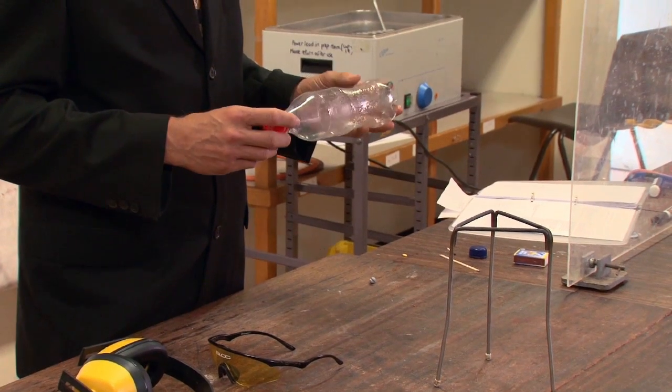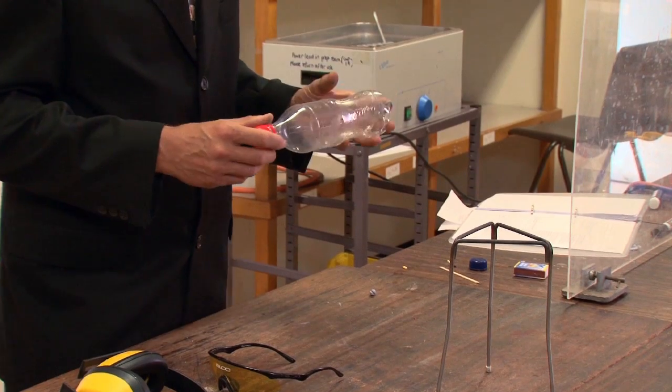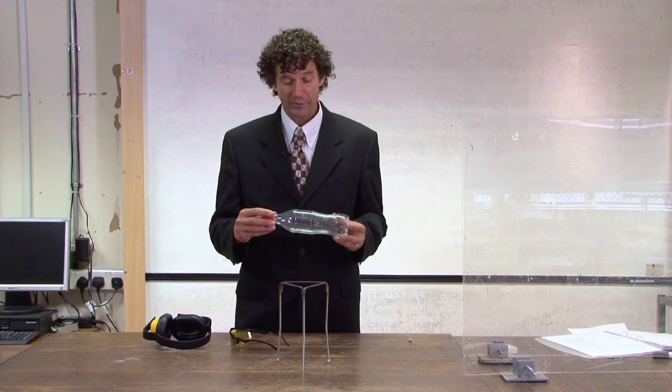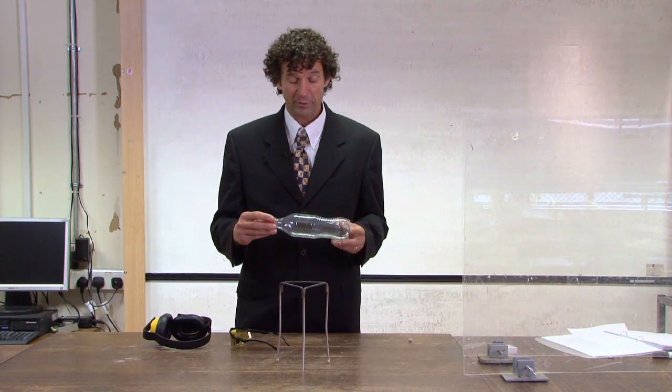This experiment fits into the curriculum quite nicely when you're doing energy transfers, chemical reactions, or when you're looking at renewable energy types. It's very effective.